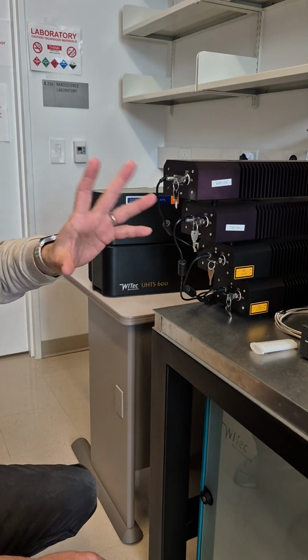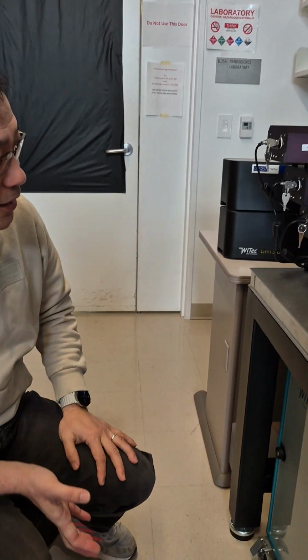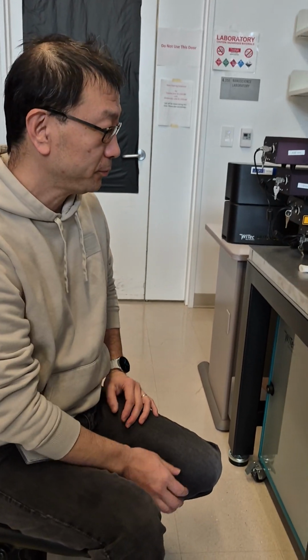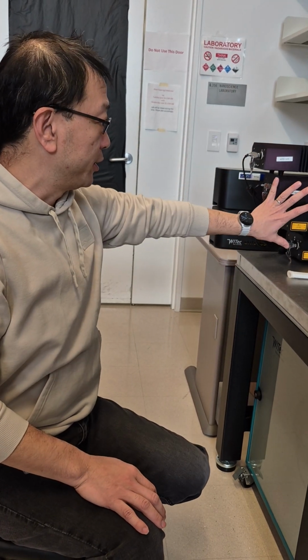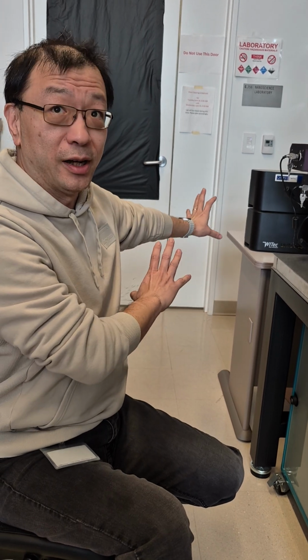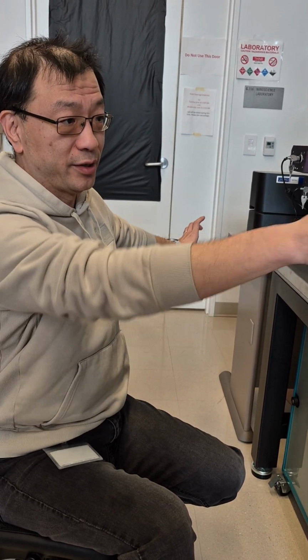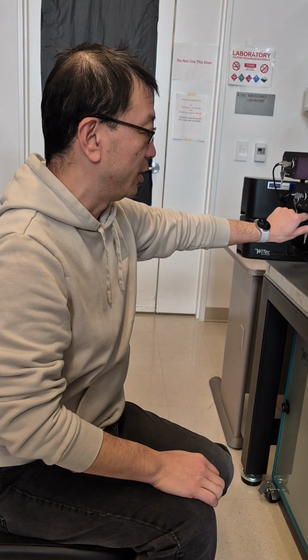In the software, sometimes they call it CCD1 or Raman CCD1. For 633 and 785, you use spectrometer 2, also called Raman CCD2. For the spectrometers, there's no operation. It's always on, but it's not in working condition. Everything is controlled by the server and the software. For the laser, the only operation is you turn it on, turn it off.